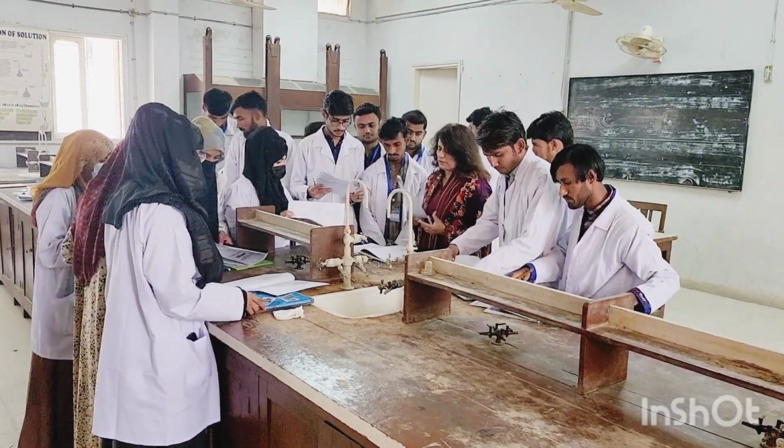Hello and welcome to another video. I have just explained to my students how to write down the journal for experiment number 1, how they are going to begin their first experiment, and how they are going to prepare their journals and begin with step number 1, that is the preliminary examination. As you know, the preliminary examination has many steps, so they will come across all those steps today.